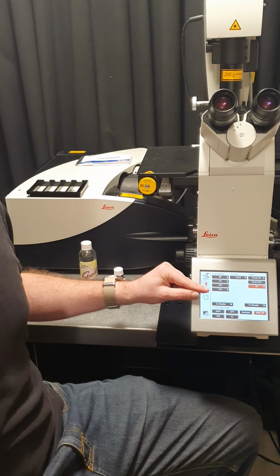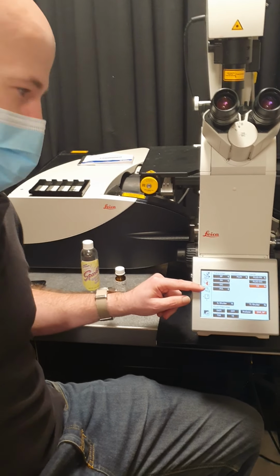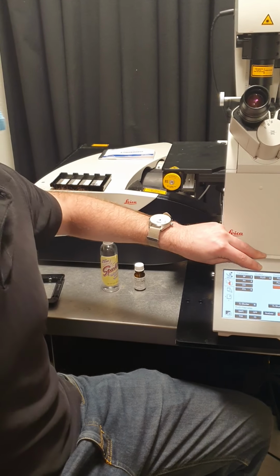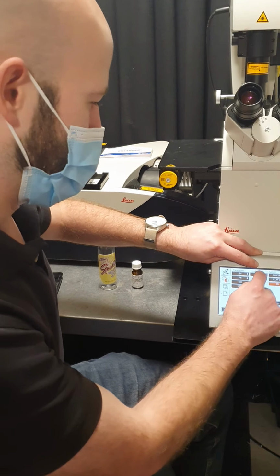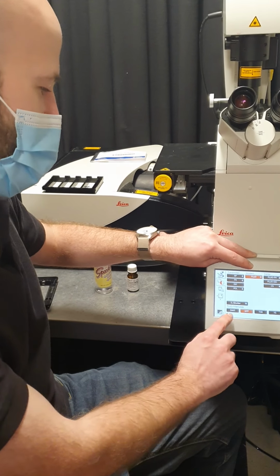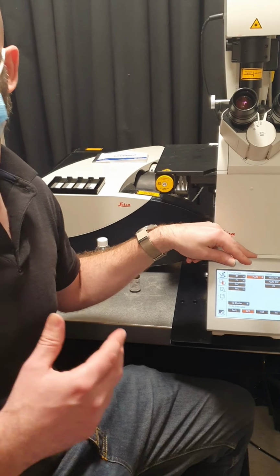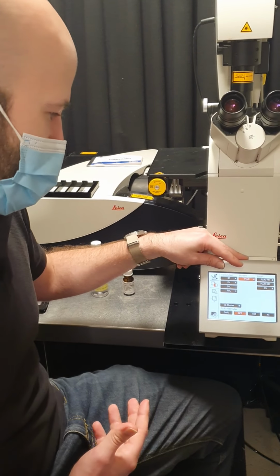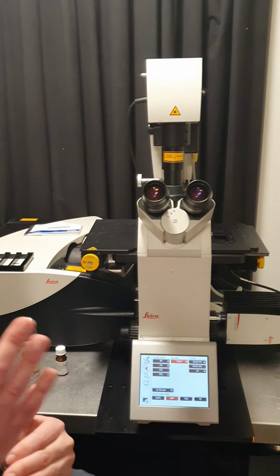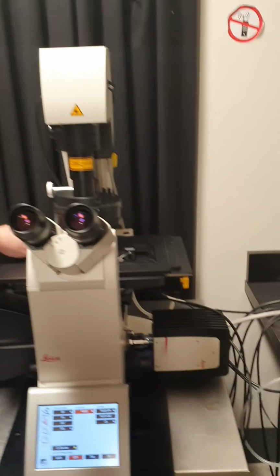And then the last is polarized light, which can be used for some specialty things like some fibrosis stains, for example. Then under incident light here, there's just one option, fluo. This is wide field fluorescence. And if we click on that, then we can choose our filter cubes, 4 filter cubes: DAPI, GFP, Texas Red, and Cy5. So those correspond to your standard blue, green, red, and far red fluorescent dyes. And you can see we've got a shutter control here, so if it's gray, that means no light is being sent to the sample. And if we click on that and it's yellow, now we can see light is being sent to the sample.